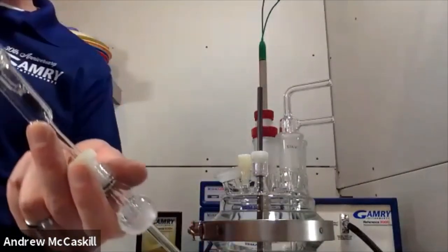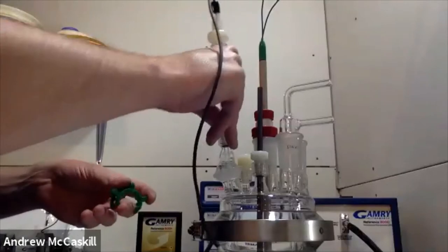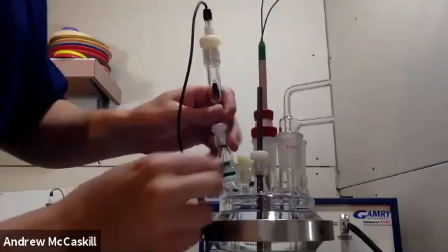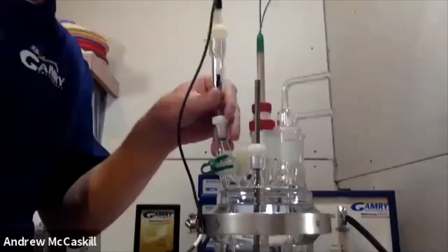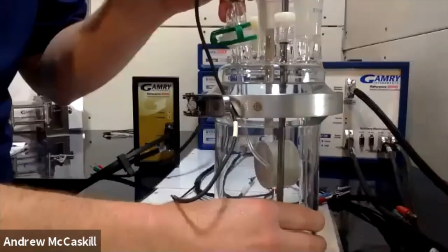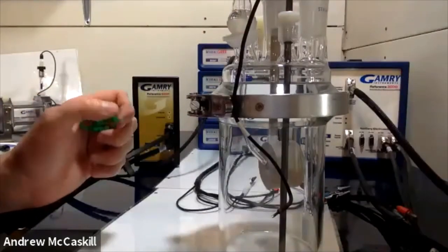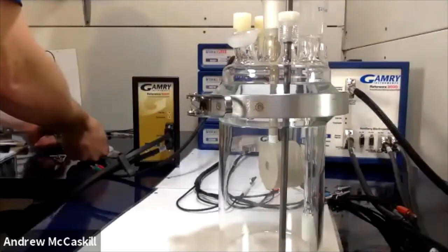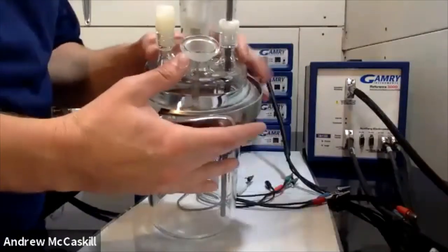The ball joint allows a little bit of movement to rearrange the angle as necessary — you can position it very close to the surface of the working electrode in the center. There are extra ports at the top: a number seven ACE thread for a graphite counter electrode, two more number seven ACE threads, and two 24/40 ports up at the top.